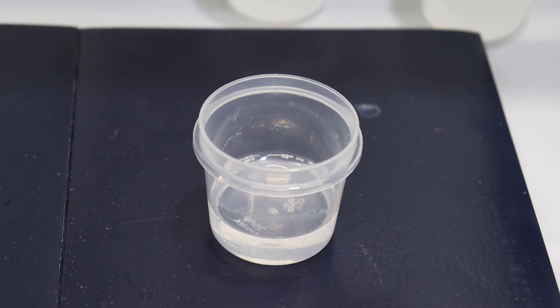Here it's cross-linking and forming a solid. We can't really see anything because it's happening fairly slowly and it's not very visual. What will be happening eventually is it will form a solid and phase separate from the solution, so we'll end up with a solid mass. I didn't manage to catch it on camera because it takes a long time and then it suddenly appears to be finished — it happened overnight. In the next cut we'll come to the next day and have a look at it when it's formed pretty much a coin of solid material at the bottom of the container.